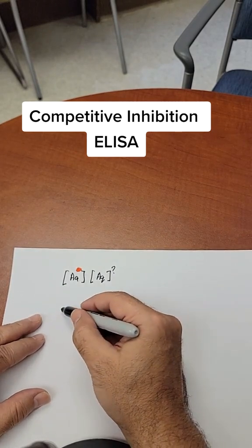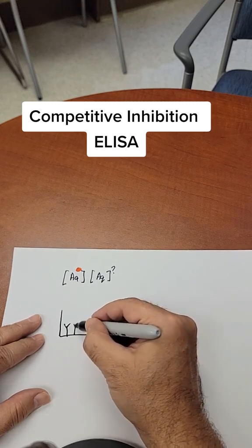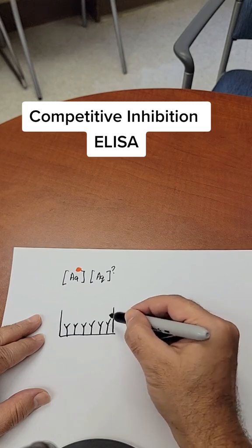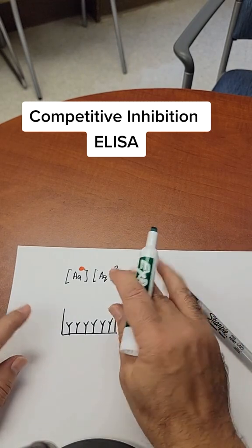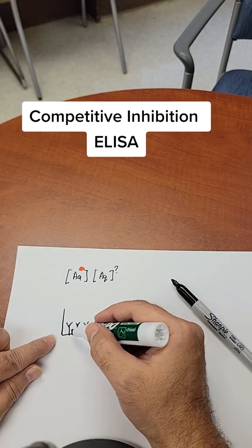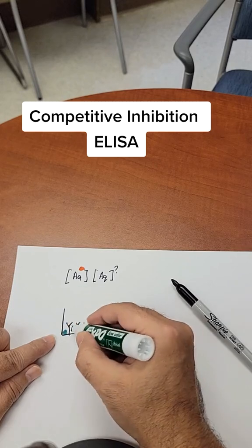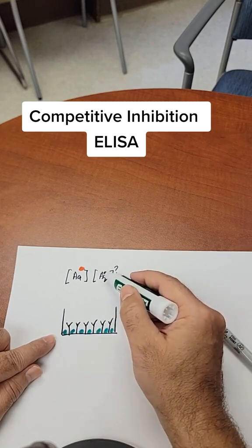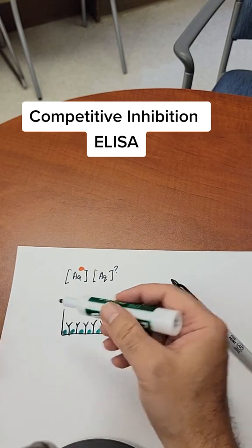For that reason, we are going to use a specialized ELISA plate, which has a high affinity to bind proteins. Our monoclonal high affinity antibody is going to be bound in the plate. It's important that before we start any experiments, we block all the unoccupied sites of the plate with usually bovine serum albumin or Tween 20. These sites will be blocked.